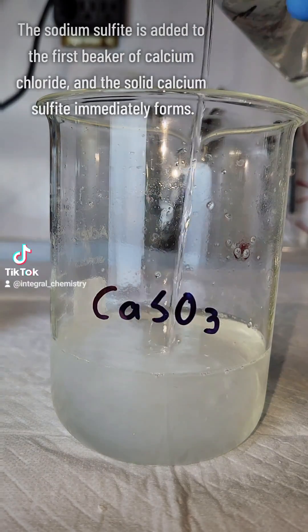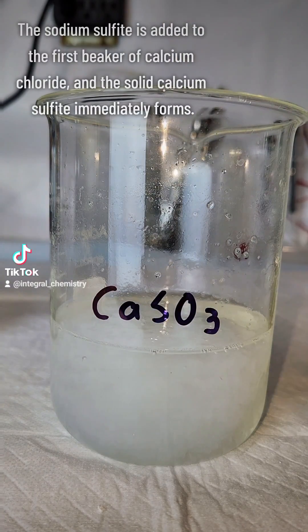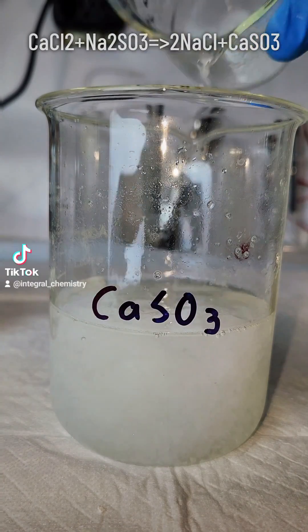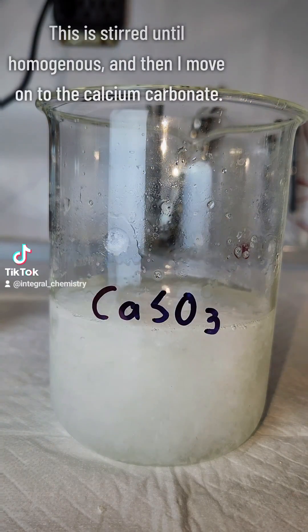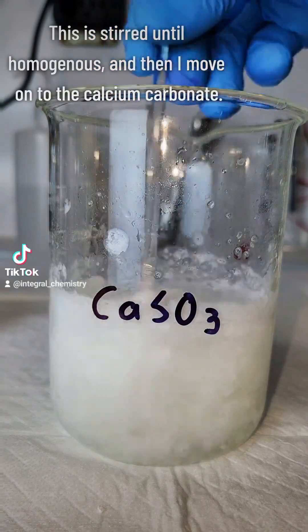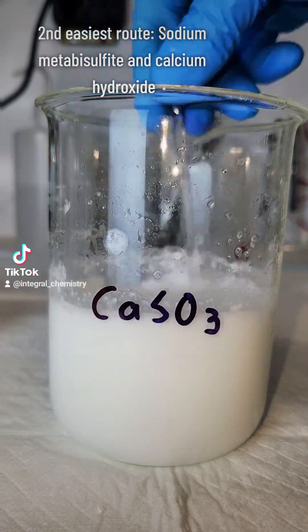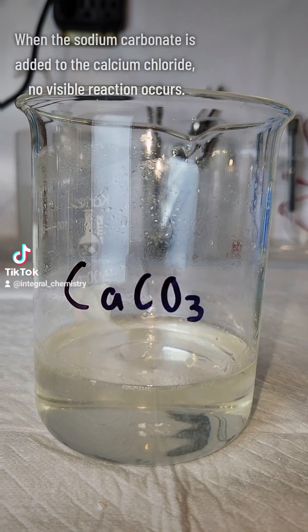I decide to make the calcium sulfite first, and to do that I pour my solution of sodium sulfite into my solution of calcium chloride. A white precipitate of calcium sulfite immediately forms, and this is stirred thoroughly. This same reaction can also be done between sodium metabisulfite and calcium hydroxide.